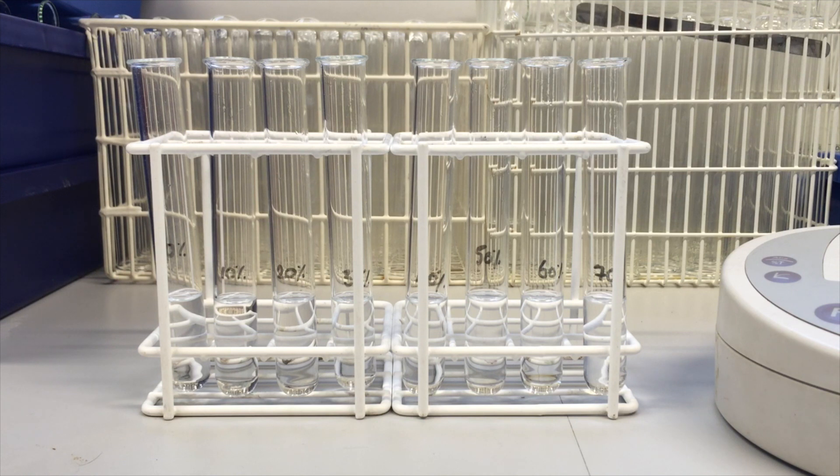Volumes should be the same, and we've got our varying concentrations of alcohol now, and we can begin our experiment.